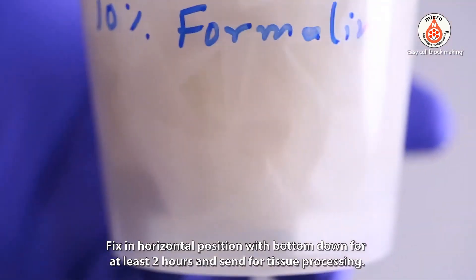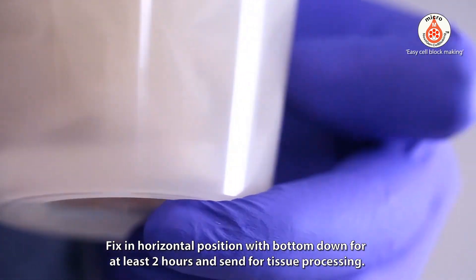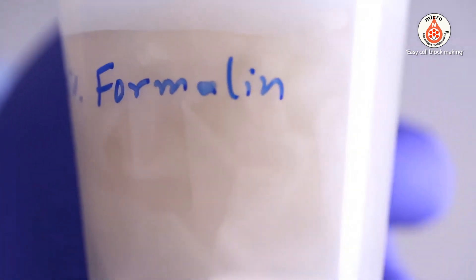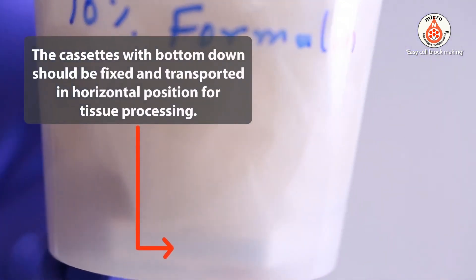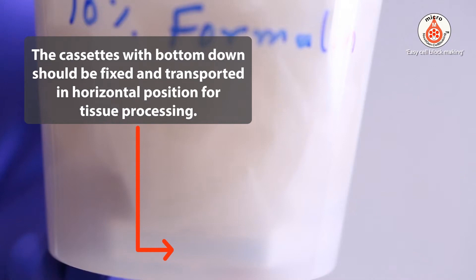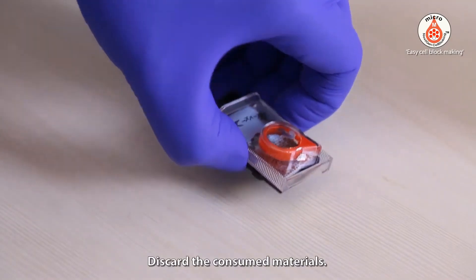Fix in horizontal position with the bottom down for at least 2 hours and send for tissue processing. The cassettes with the bottom down should be fixed and transported in horizontal position for tissue processing. Discard the consumed materials.